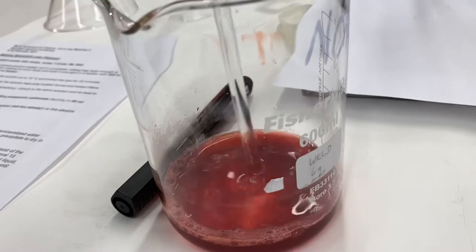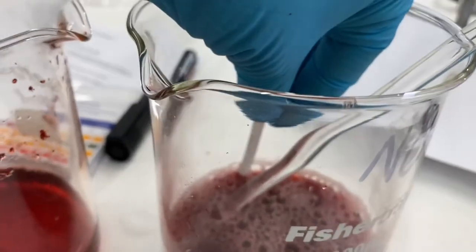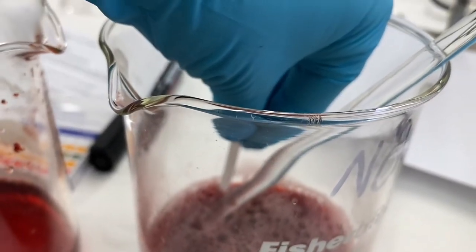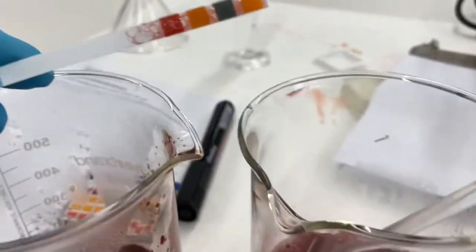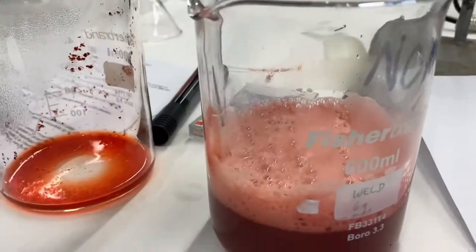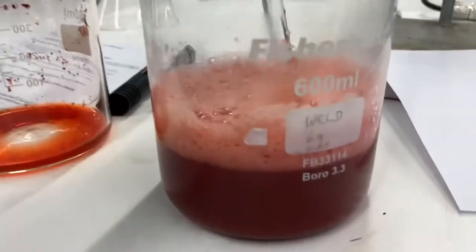As this happens one should be checking the pH and it should be no less than 6 on the scale. You may notice some pink froth forming. This is normal.